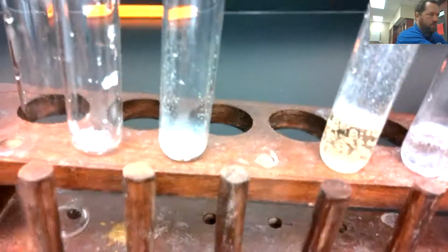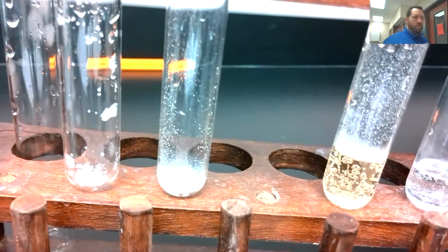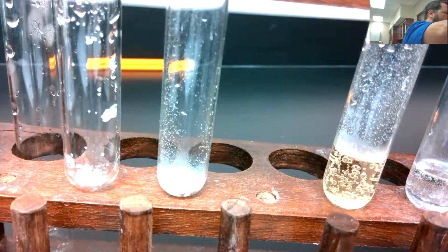Water, and we're going to see if these dissolve. So if you've looked up the rules, you know what to expect at this point. There are our white salts. Again, they look very much like the salt you put on your French fries. A lot of salts do, but let's see what happens when we add water.